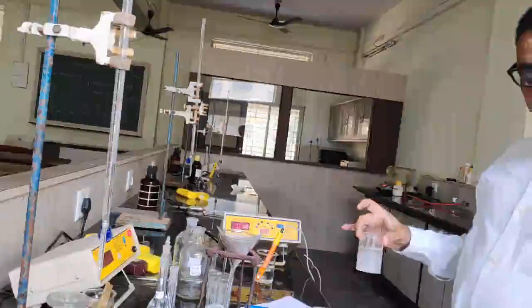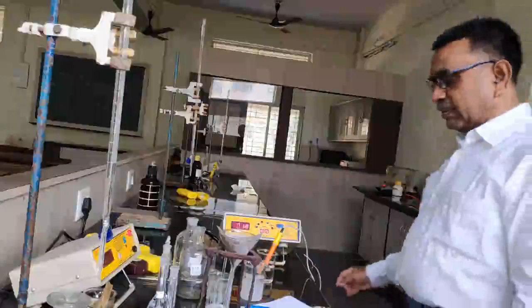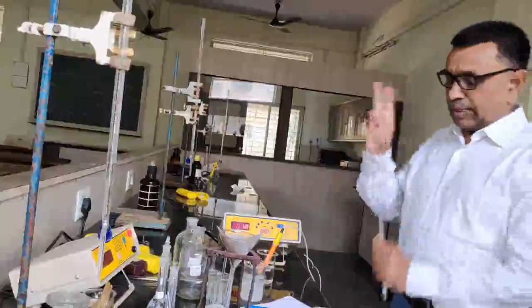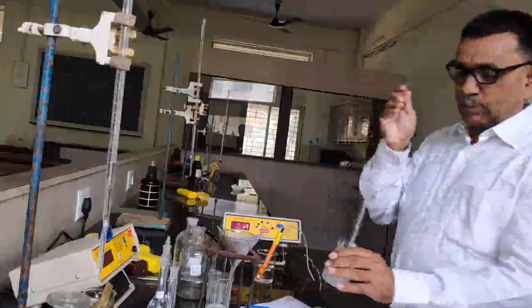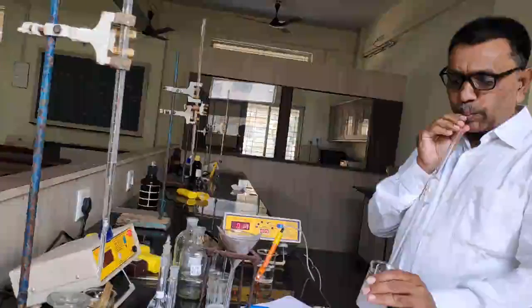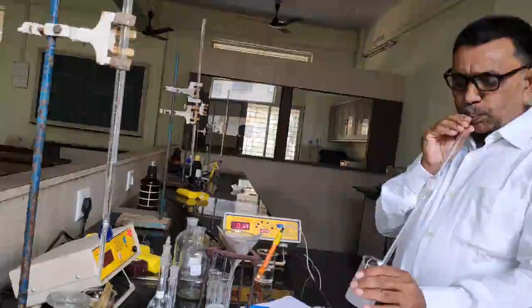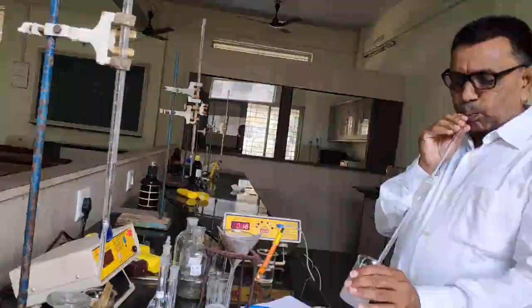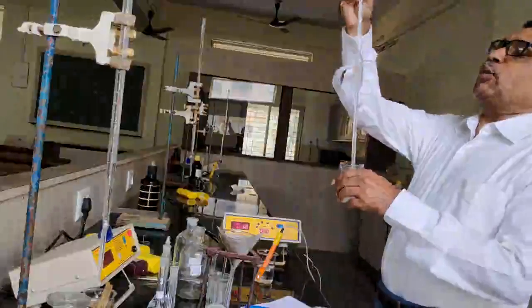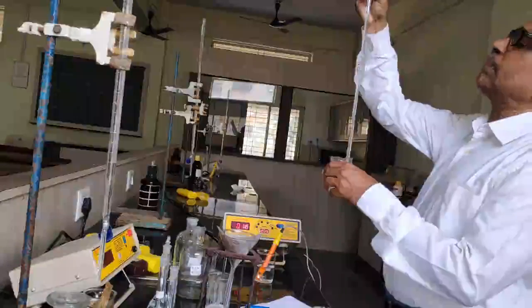Now in that filtered solution, I would like to take 25 ml of that filtered solution in the beaker.